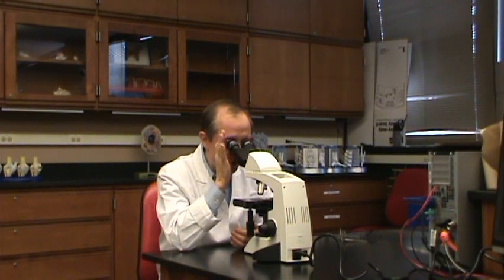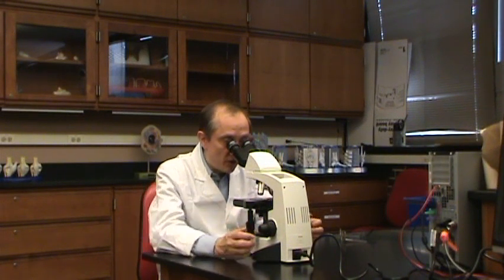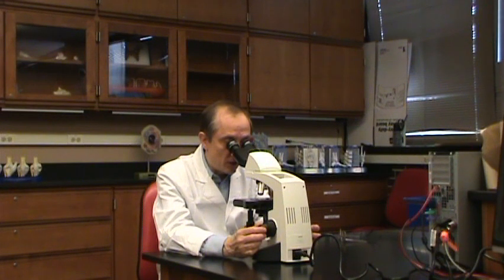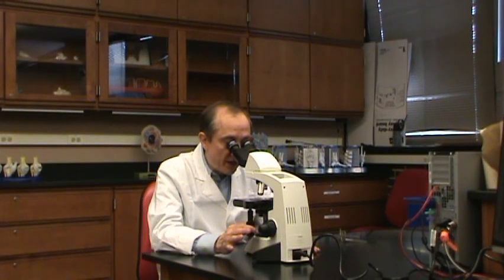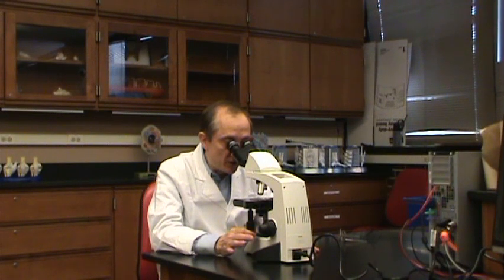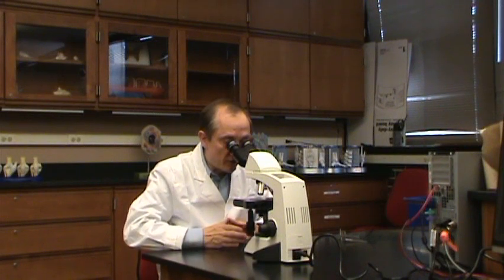Once you have a good image, you're ready to look around. This scanning objective lets you look around over the slide. Use the mechanical stage to move in the x-axis and the y-axis. In this case I'm looking for small dark blue specks, which are going to be white blood cells. I found some and moved them into the center of the field of view.